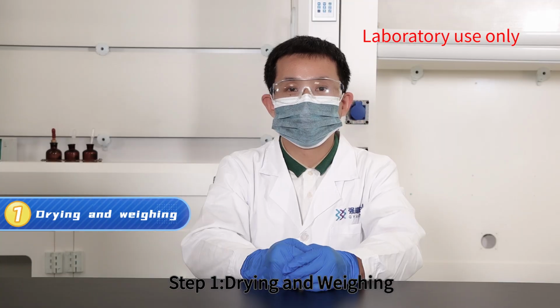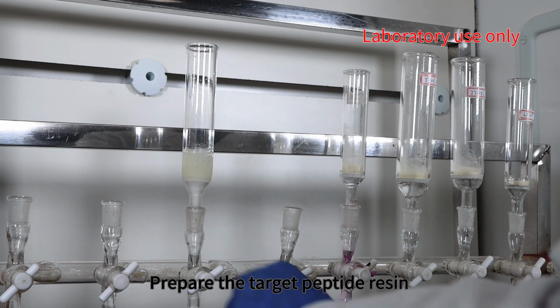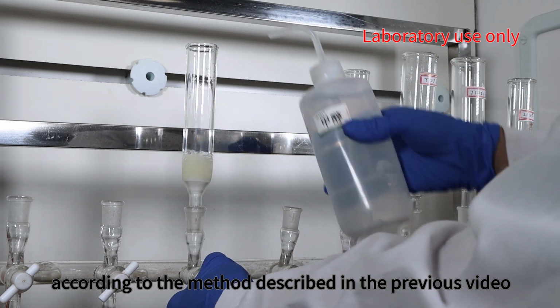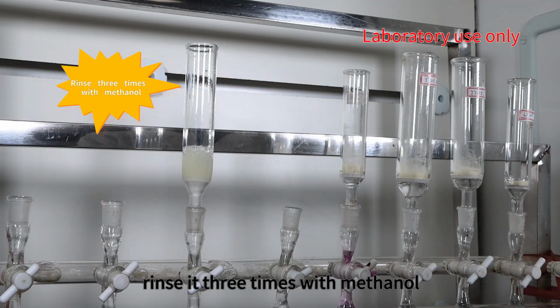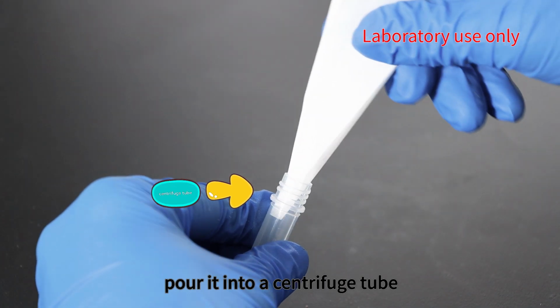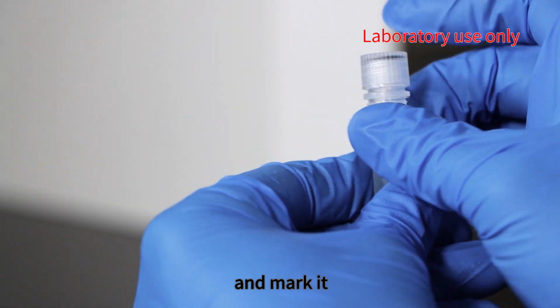Step 1. Drying and weighing. Prepare the target peptide resin according to the method described in the previous video. Rinse it 3 times with methanol. Then dry and weigh it. Pour it into a centrifuge tube and mark it.